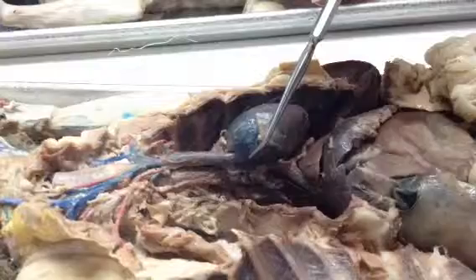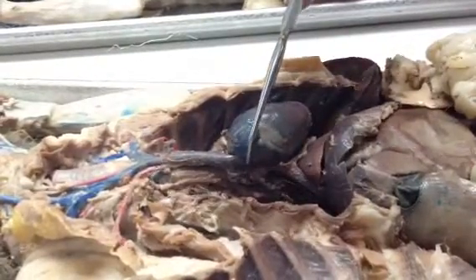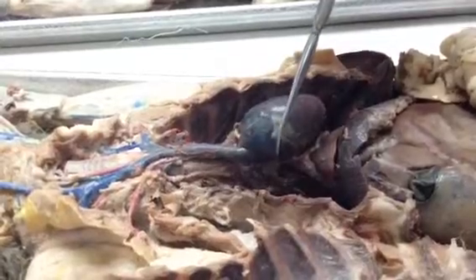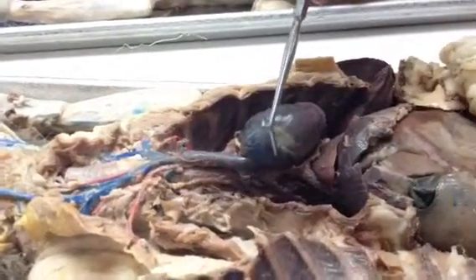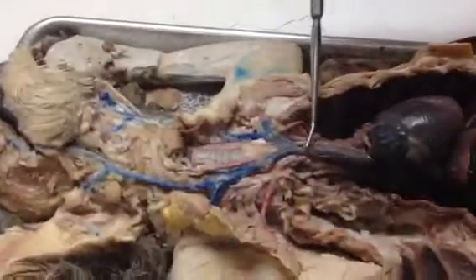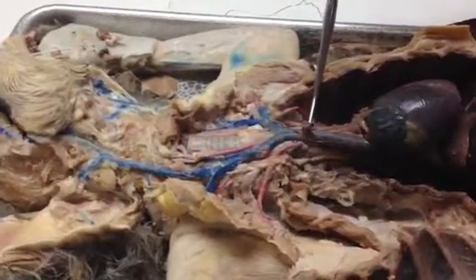Okay, I do have a cat that will be used on the lab practical where this has not been cut, so please keep that in mind, that you will be looking for a vein that's coming off of the right atrium, and of course it'll be on the right side of the cat. So if you're looking at this and I have something pinned over there, that would be the azygos. So coming off of the anterior vena cava, we have this vessel right here. This is the mammary vein.